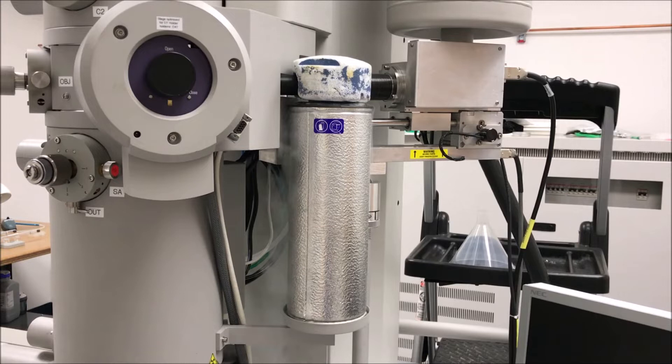You could operate your microscope without using the cold trap, but you run the risk of contaminating the specimen, which, as I've discussed in my video on contamination, can negatively impact the quality of your results. So that's what a cold trap is and why it's useful. Now we're going to talk about how to use it.